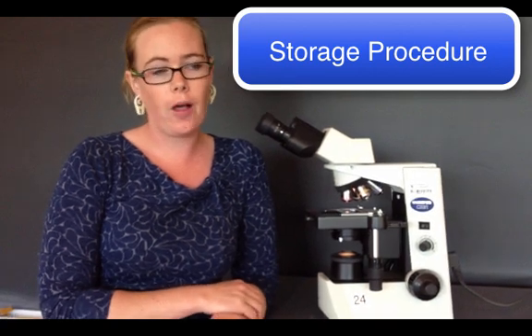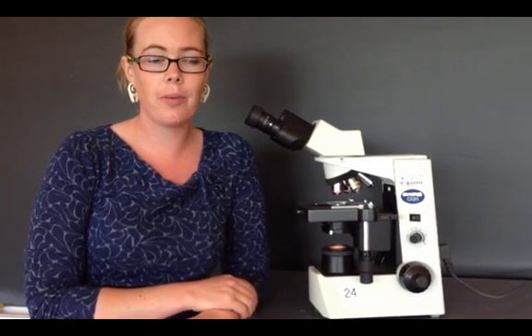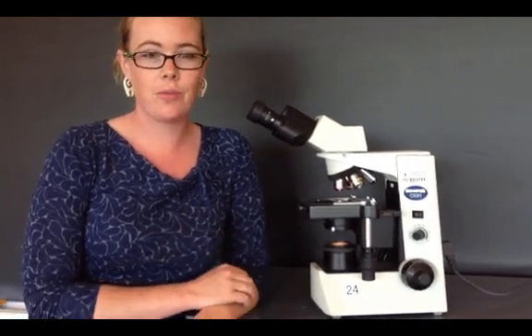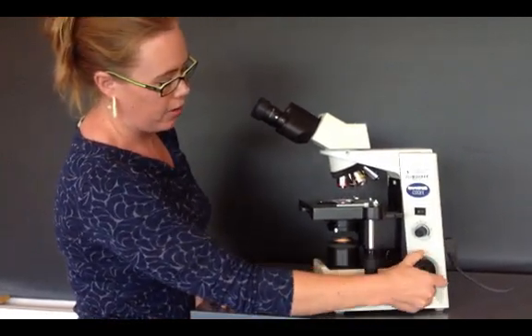make sure to follow basically the setup procedure in reverse. That way, the next person who goes to use your microscope doesn't have to fiddle with it a bunch. So, lower your stage all the way down to the bottom.